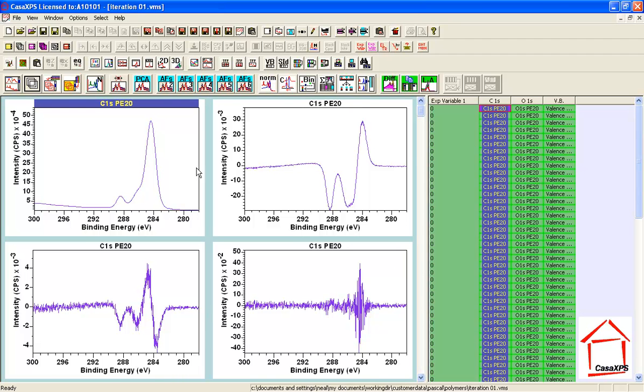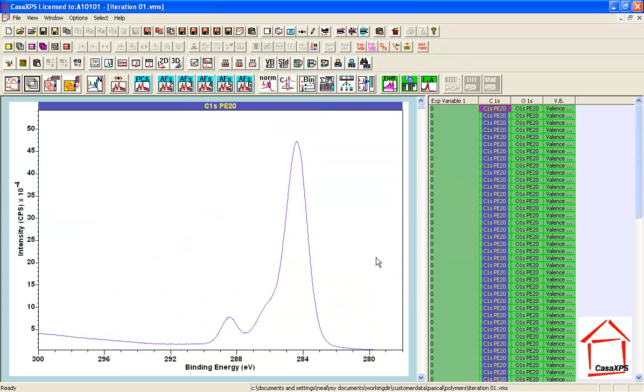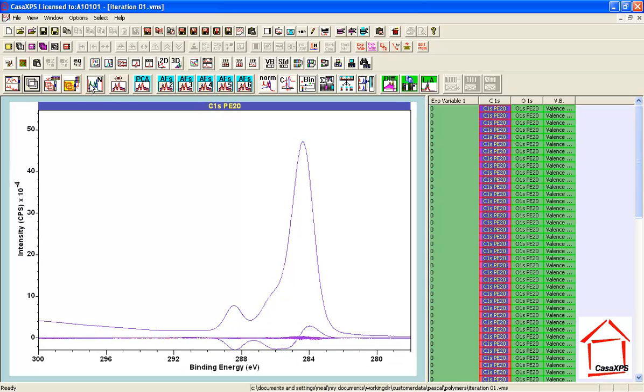So when I look at the first 4 abstract factors that are calculated, the first one looks like the average spectrum. The second one has peaks that are reminiscent, albeit negative going peaks, of the carbon bonded to oxygen, both double and single bonded. And then we have another that looks like some adjustment. Perhaps this is a shift of some description in the data. And the fourth one looks very much like noise. So in principle, what we ought to be able to do is reproduce all of these data using 3 abstract factors. In fact, if you look here, the relative intensity of these abstract factors, 2 of them really dominate, so that third one is not nearly as important as the first 2.